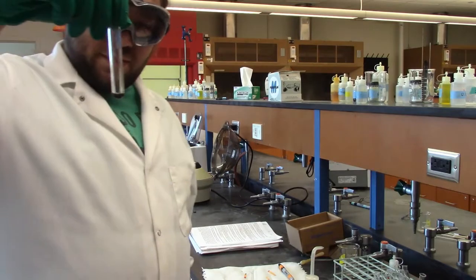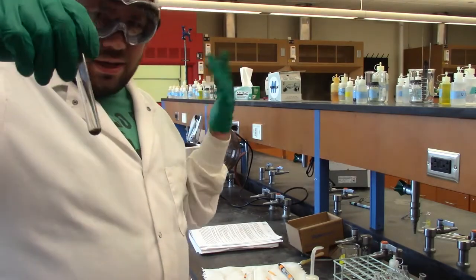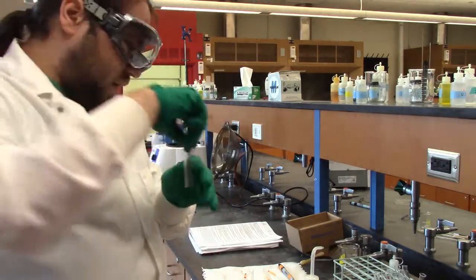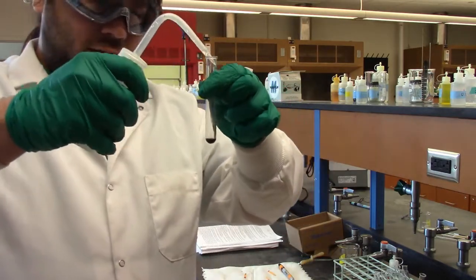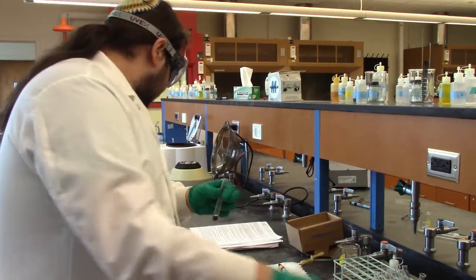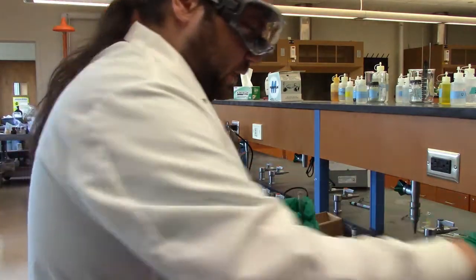Okay, so here's our precipitate, and it should have our copper and our bismuth. Like I said earlier, when you decant stuff, you're never going to perfectly get all the solution out. So there's still a little bit of water in there, but that's fine for this one. We don't have to worry about that like the other step when we washed it. We're going to add some more water in, though, so it's not just sitting on the bottom. So I add my water, and I'm going to add 6 drops of nitric acid.